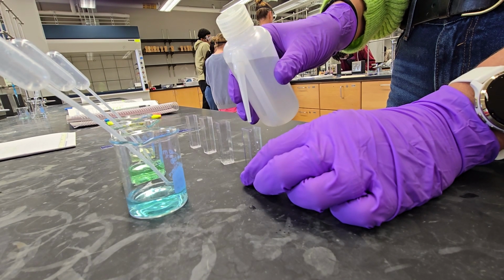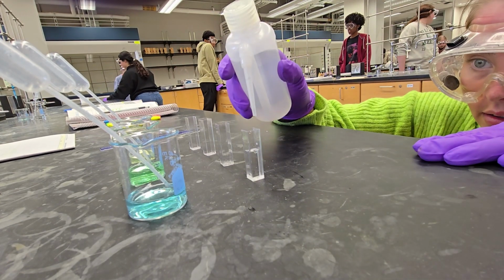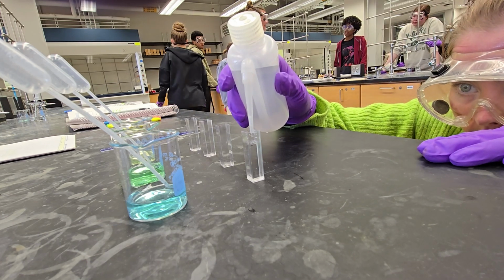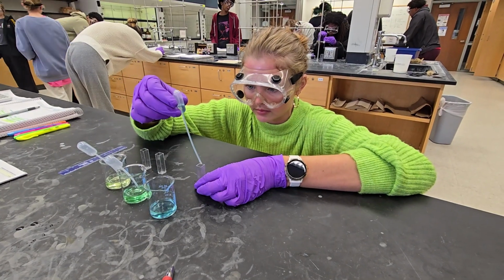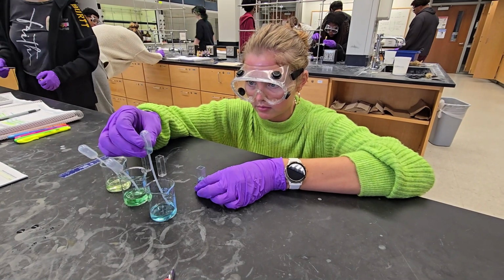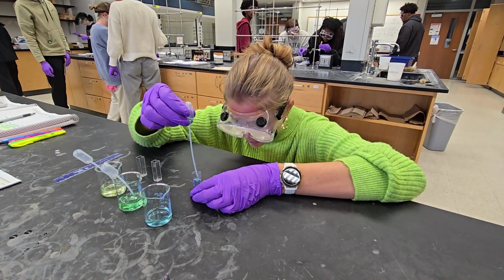In this video, you will see us use a spectrophotometer to scan 3 different concentrations of a solution across all wavelengths of light. A spectrophotometer is a piece of equipment used in chemistry to scan samples of solutions by shining light through them and recording how much light gets absorbed at different wavelengths.